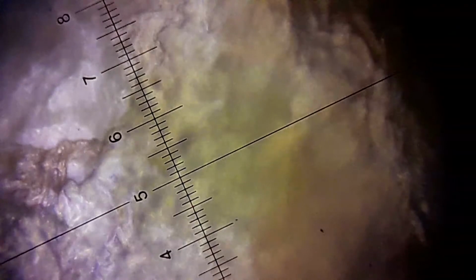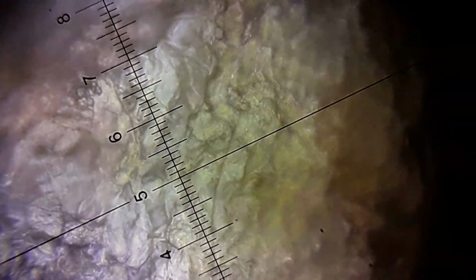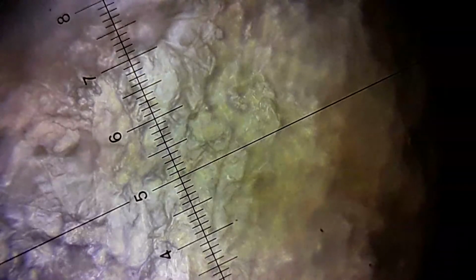In a telescope, the Barlow lens increases the power, or actually the focal length, of the telescope, but decreases the field of view. I think the same will happen here, but with microscopes it will decrease the magnification power.